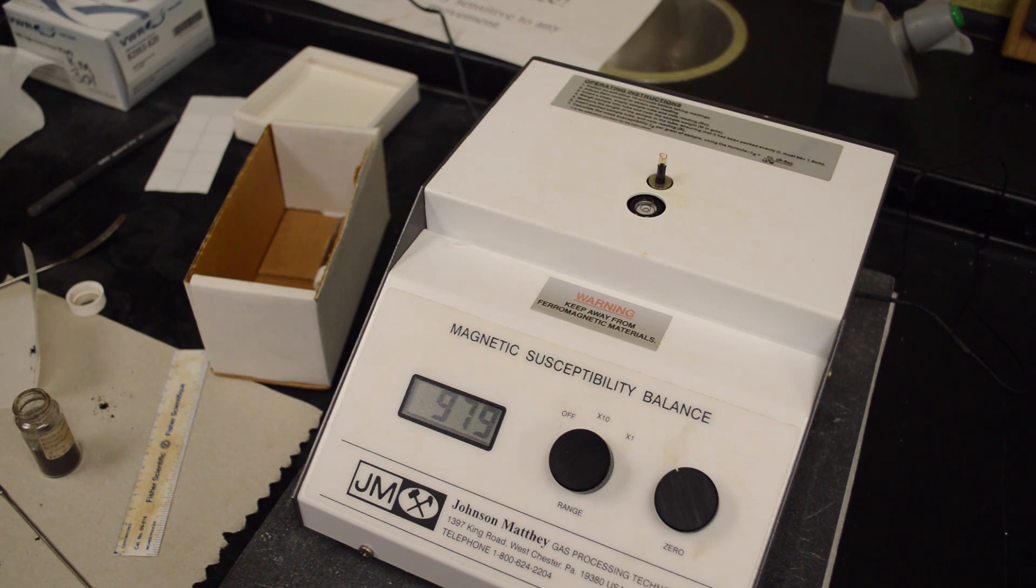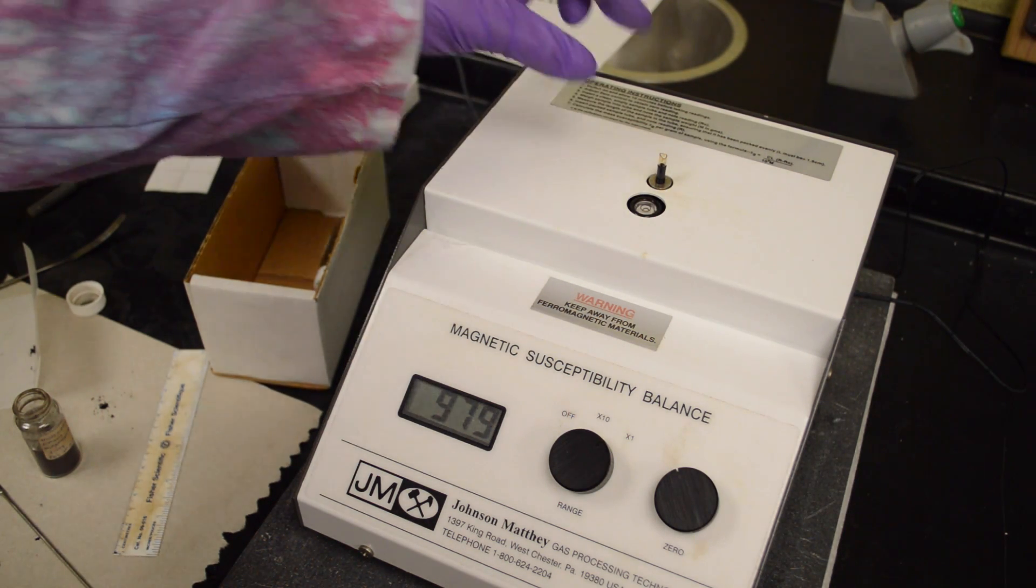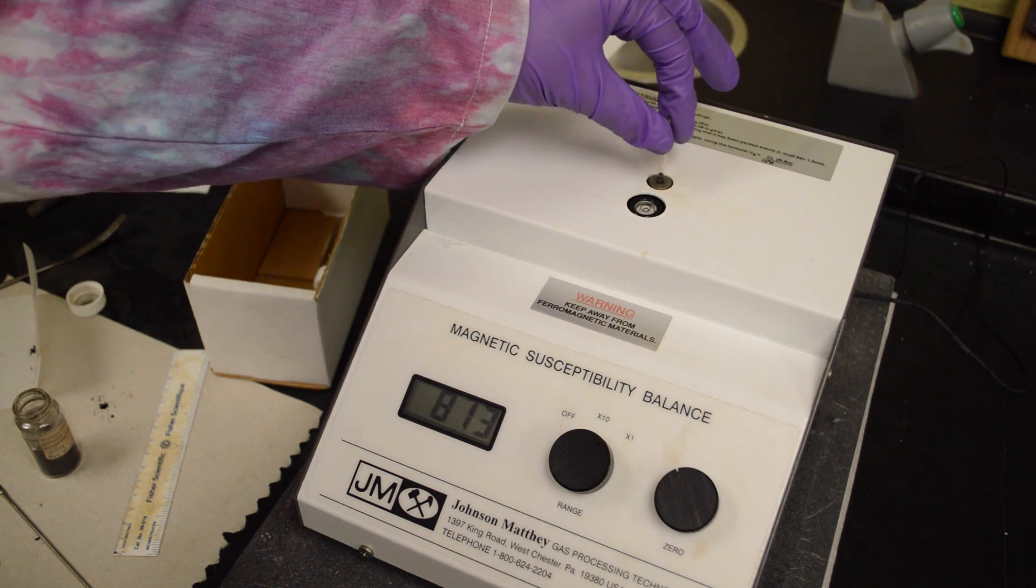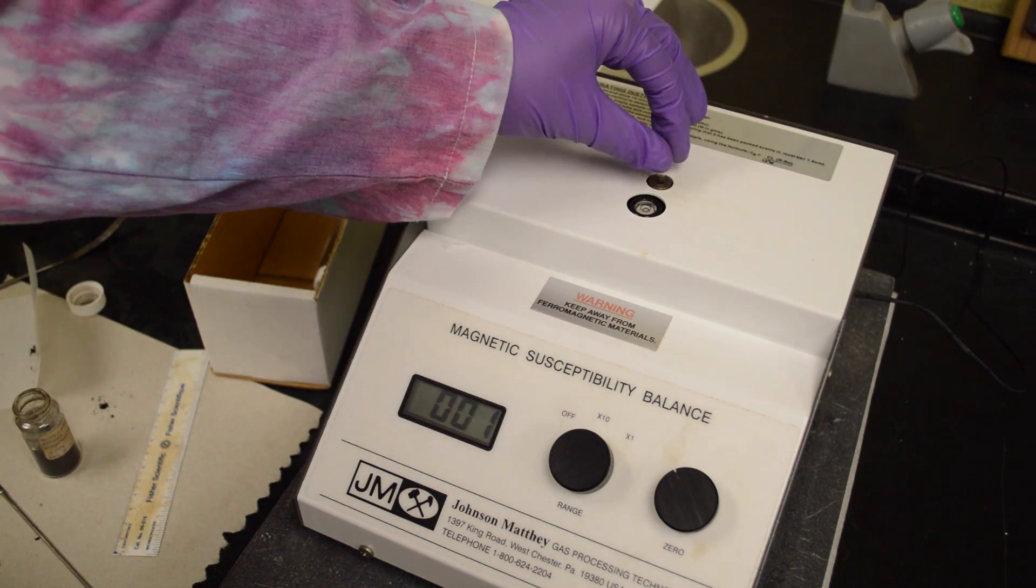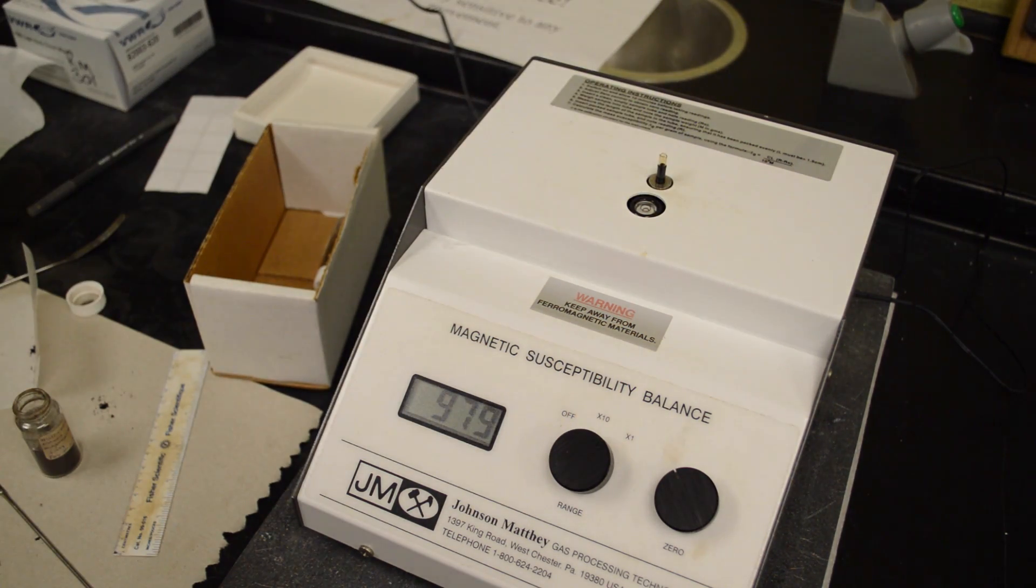Here we can see that the balance is reading 979, then 78, 79. So we're going to remove it and try it again. Here you can see we have two of the same readings.